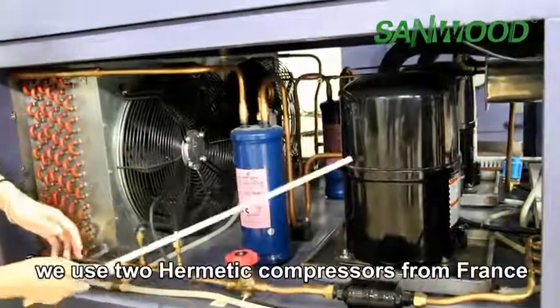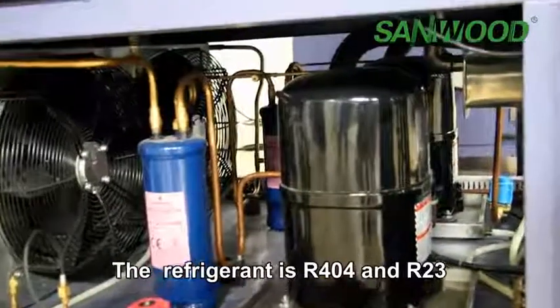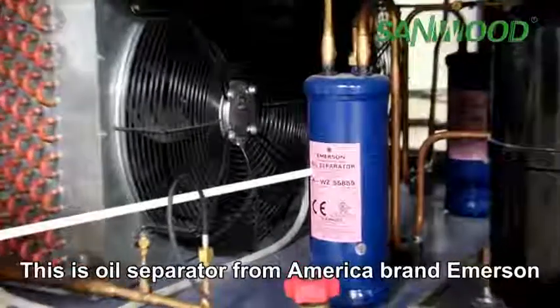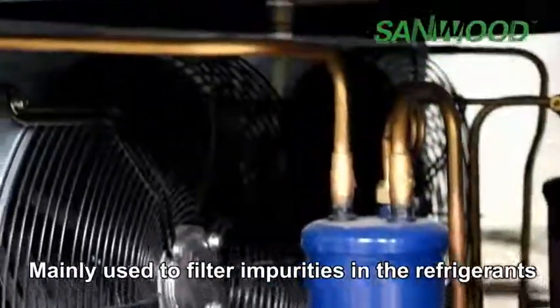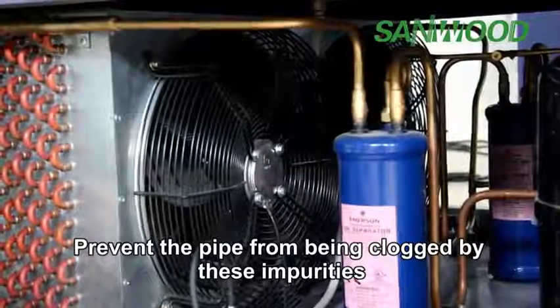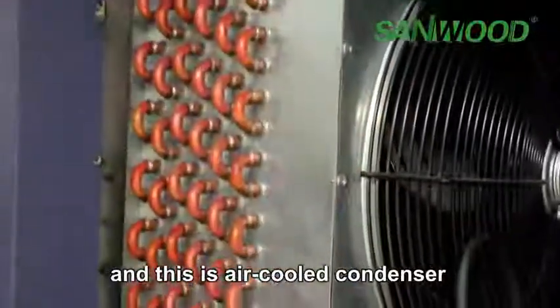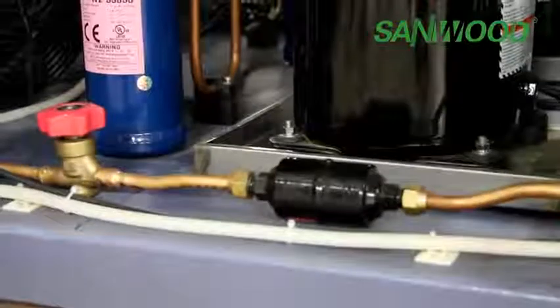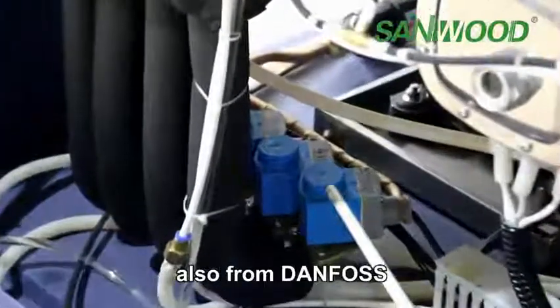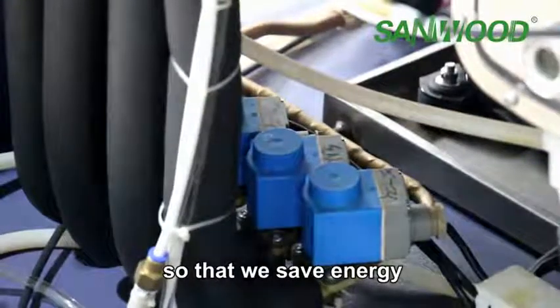In this chamber, we use two compressors from France, famous brand Tecumseh. The refrigerants are R404 and R23. This is an oil separator from American brand Emerson, mainly used to filter impurities in the refrigerant and prevent the pipe from being clogged by those impurities. The cooling method of this chamber is air cooling, and this is an air-cooled condenser, which is customized. This is a filter from Danish brand Danfoss. This is a solenoid valve, also from Danfoss, mainly used to control the flow of the refrigerant, so that we save energy.